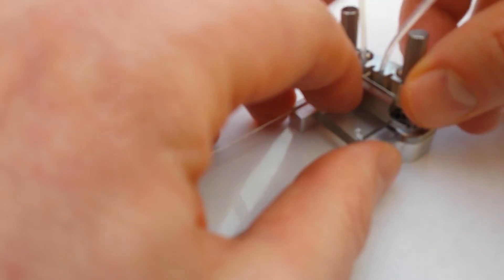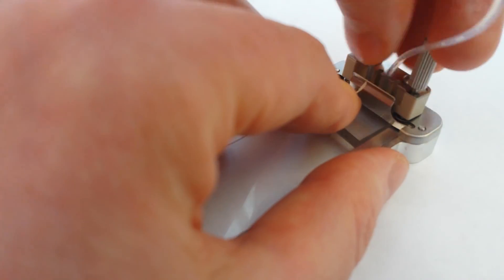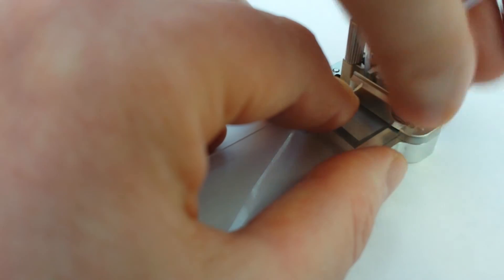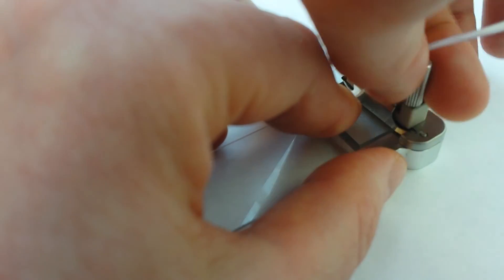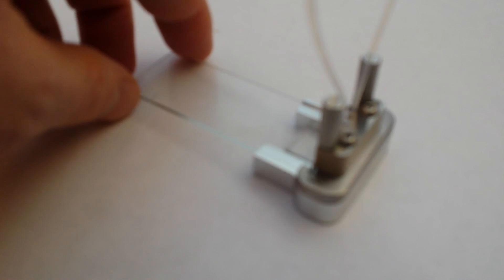Now I'm going to bring the Dolomite connector in and twist it to make the connections. And we've made very good connections to the microfluidic device. Turning it around: PDMS here, glass on top, and connections on there. That's a very elegant way of connecting to a microfluidic device.